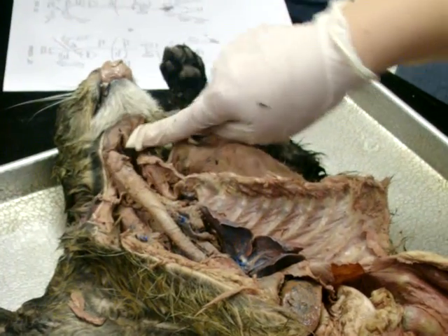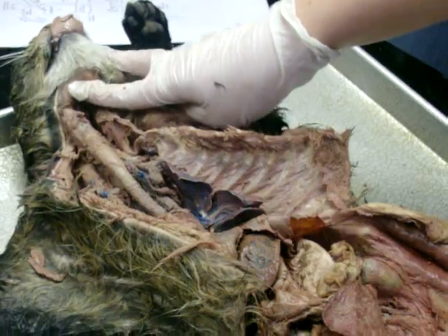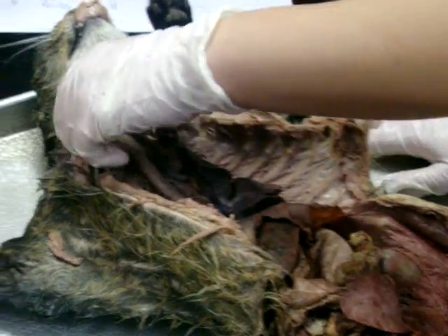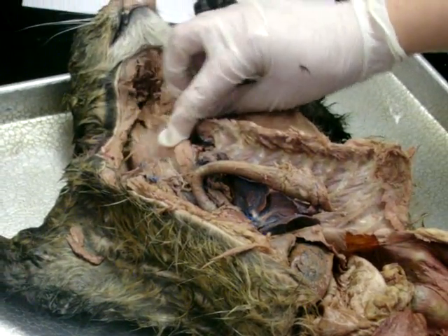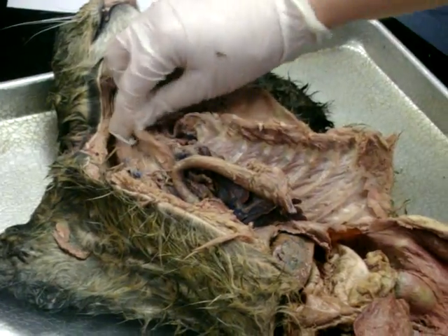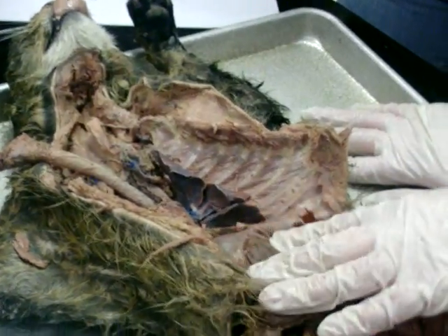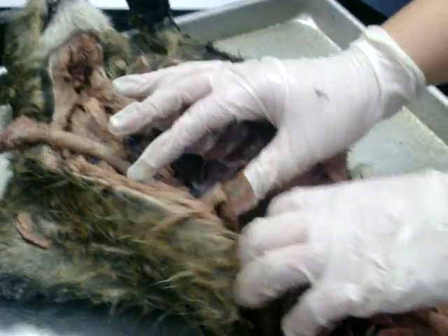Okay. Then that part I can't label that's in the back of the mouth, where the nasal cavity and the oral cavity meet, is the pharynx, right? Alright, when it's swallowed, it goes down this little flappy tube that's been cut open, that's behind the trachea, which is the esophagus, right? And then at the bottom of the esophagus, there's a sphincter. What is that one? Okay, and that's at the top of the stomach, right?